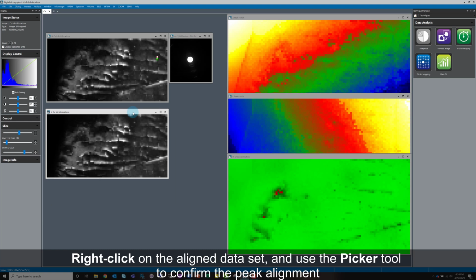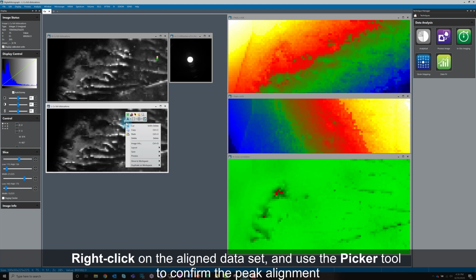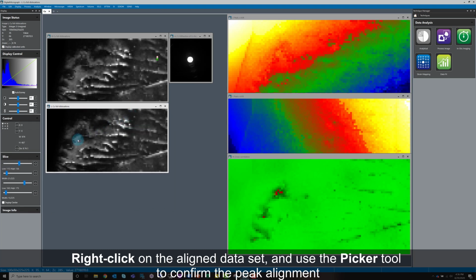Use the picker tool on the aligned dataset to confirm that the peak has been successfully aligned.